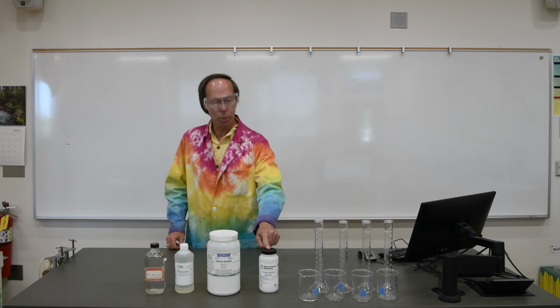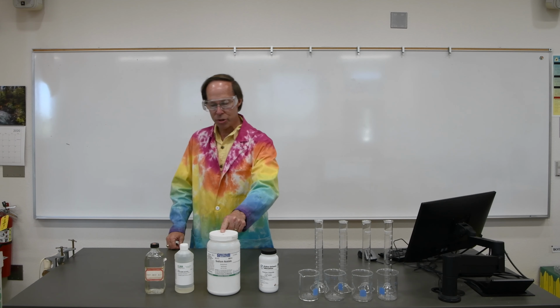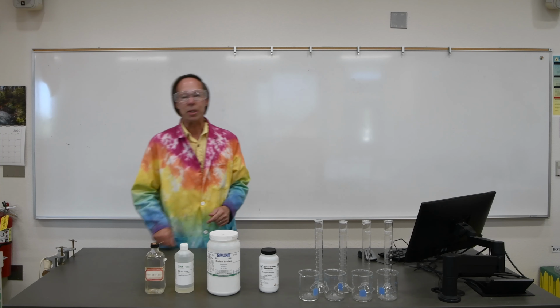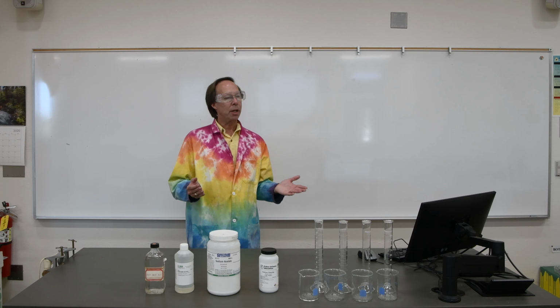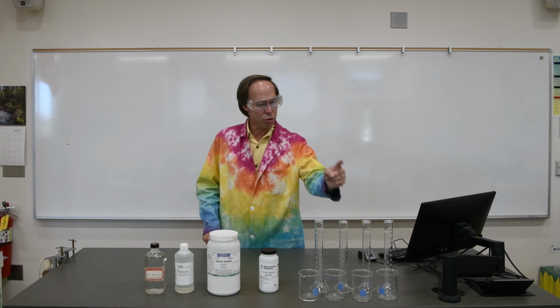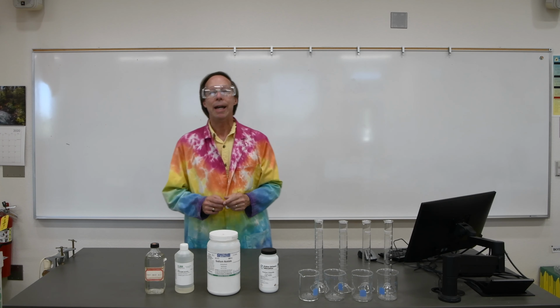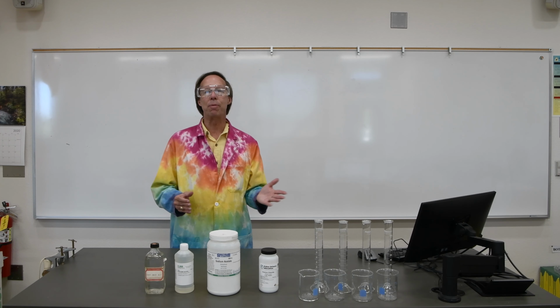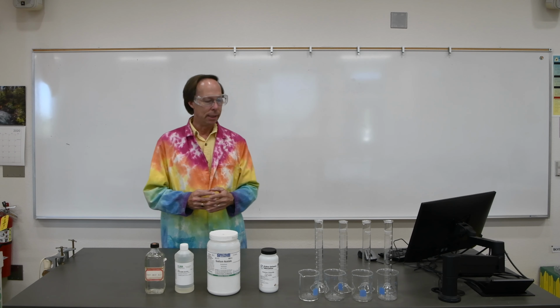We have sodium chloride, sodium acetate, ethylene glycol, and acetic acid. And we're going to be making 4 solutions of each of those, a 5%, 10%, 15%, and 20% solution. So that's a total of 16 different solutions that we'll be making.